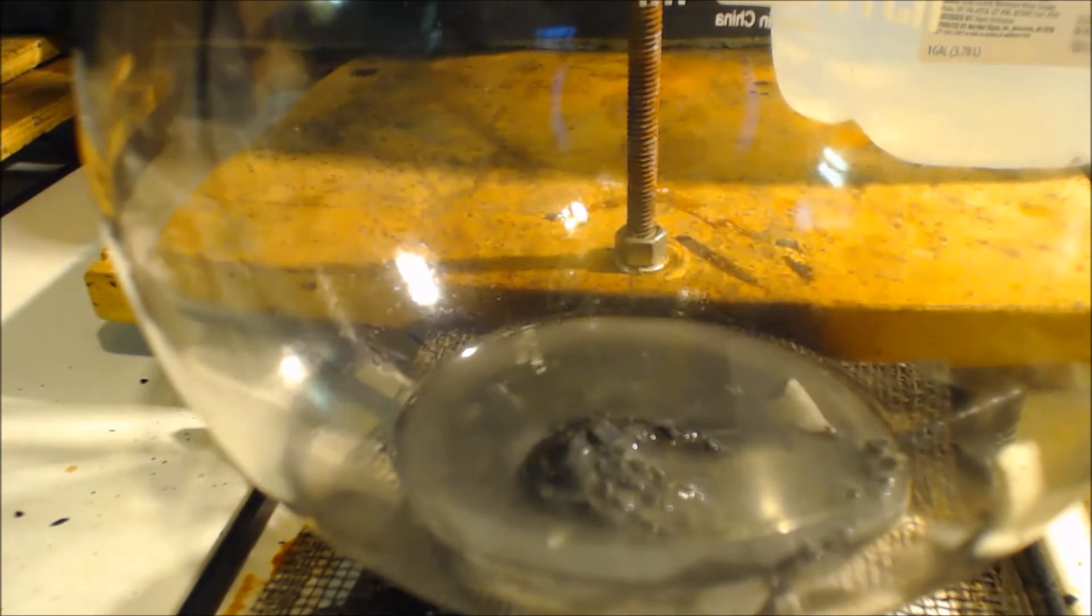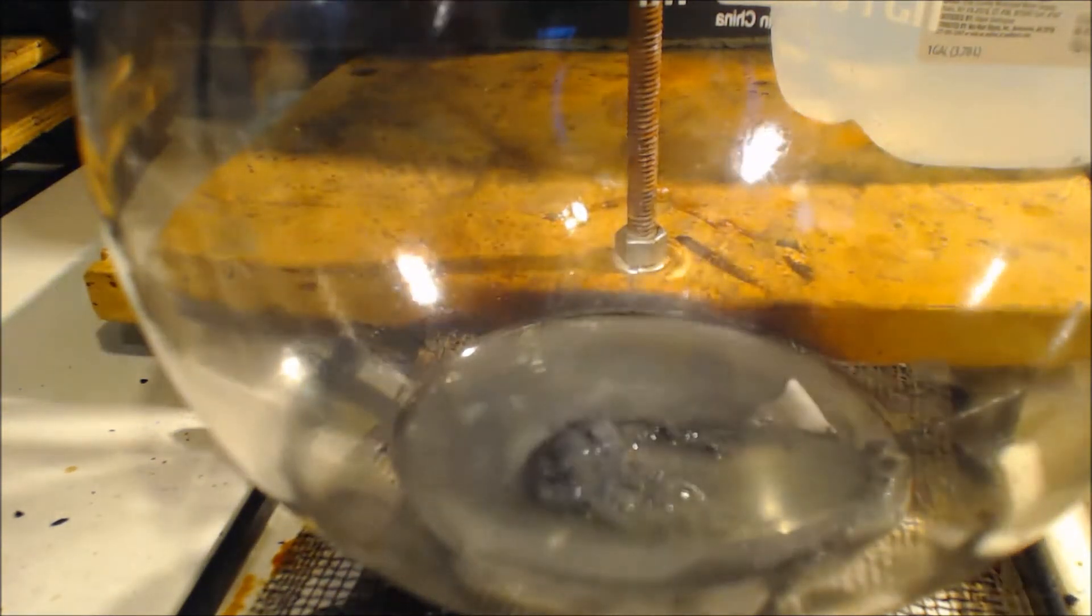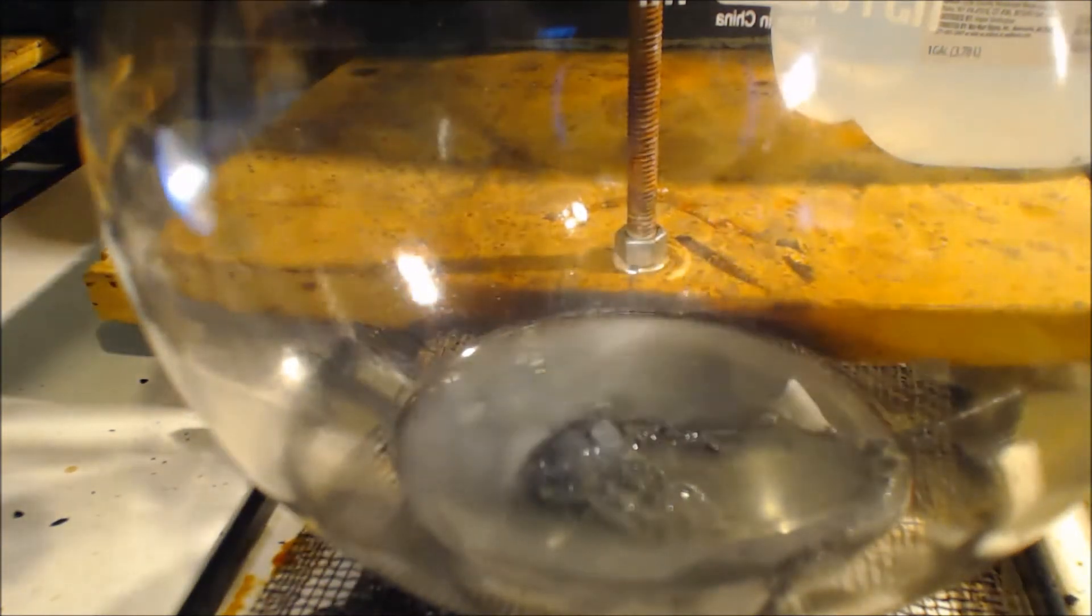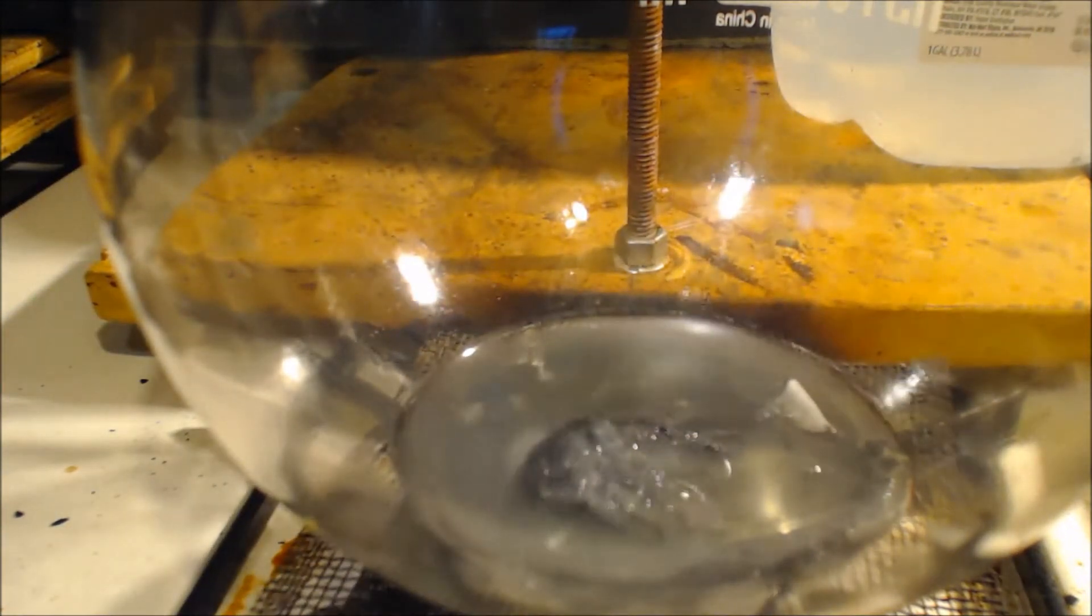It's definitely producing hydrogen. You can see it bubbling. Let's just go to fizz. I'll try to do as slow as possible. Well, half that water and sulfuric acid mixture is in there. Half of it is. I still don't see anything green. Just looks like clear liquid. Clear liquid with metal in it.